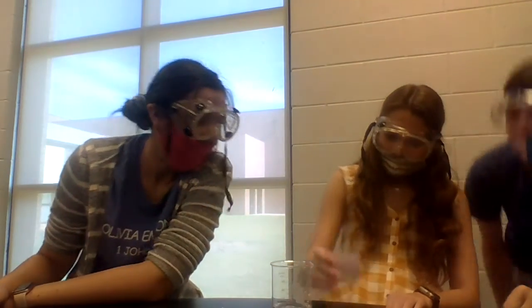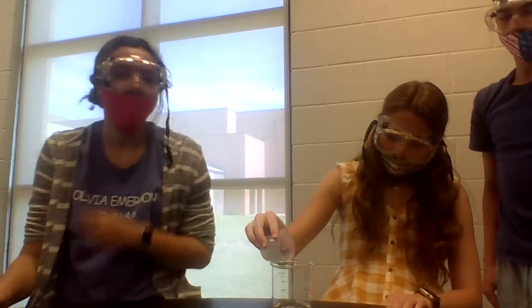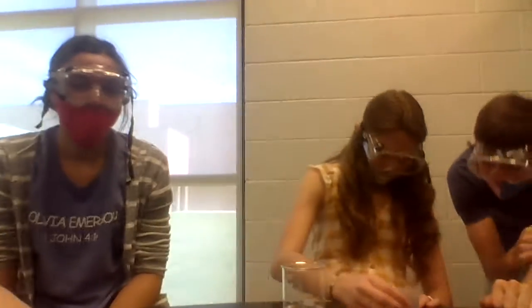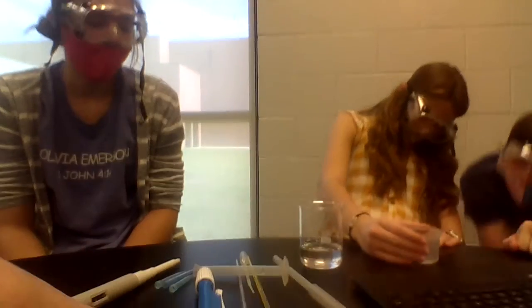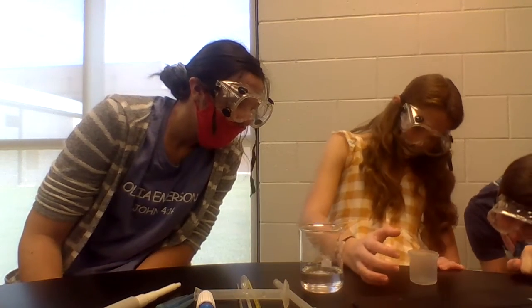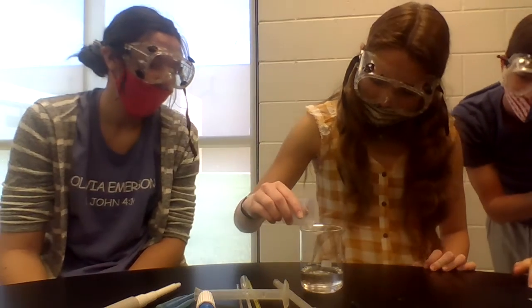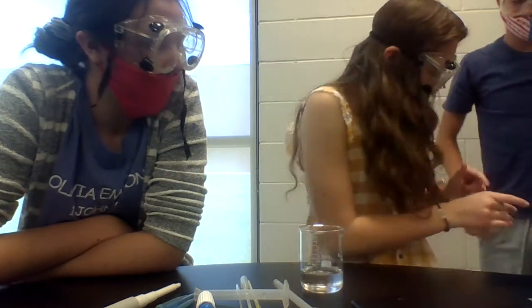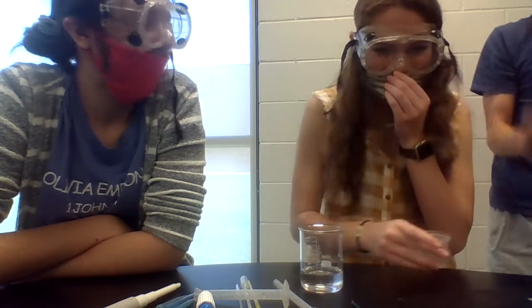That's almost 10. That's like 7. I would try... You think that's one? What? That's like 5. No. Keep going. Let's get the measurements. Keep going. There's not even water. I know, pour it in there.